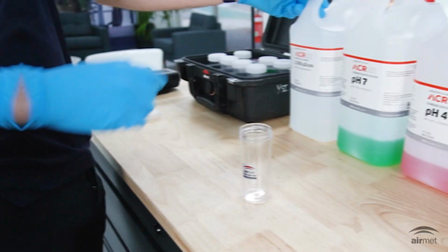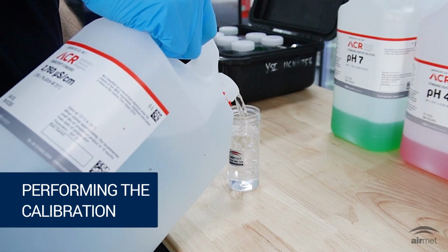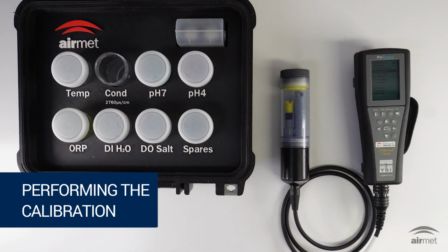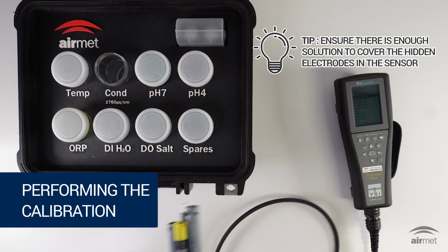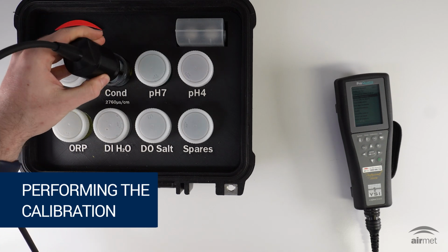Pour enough conductivity standard into the supplied bottle and fully submerge the sensor. In the case of a calibration rig supplied by AirMet Scientific, simply use the supplied calibration solution. The electrodes are in the center of the sensor, not the tip, so ensuring there's enough solution to cover the hidden electrodes is essential. Insert the probe and gently stir to remove trapped air.